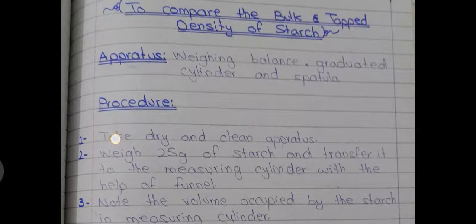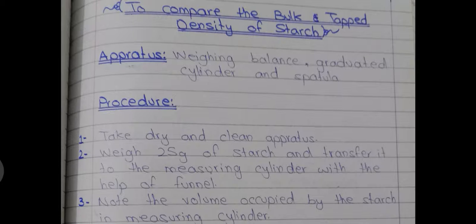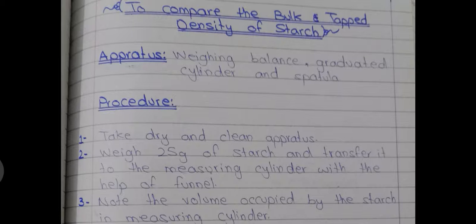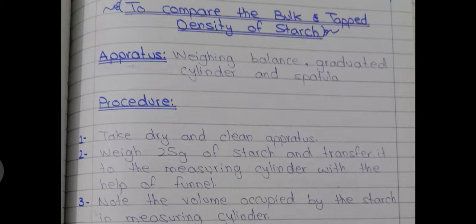Now we're coming to the other forms of density — basically bulk density and tapped density. The apparatus needed is a weighing balance, a graduated cylinder, and spatula. The density that we normally find is basically bulk density. In general we refer to it simply as density, but in detail, bulk density is the ratio of mass over bulk volume — the volume where we did not shake the substance to bring particles closer together, we just transferred it directly.